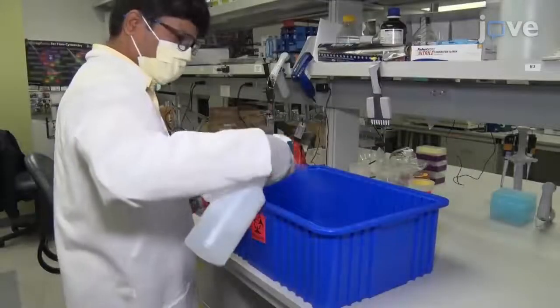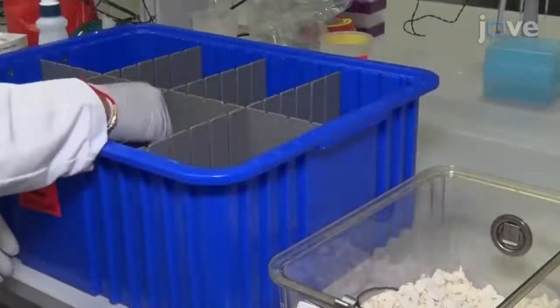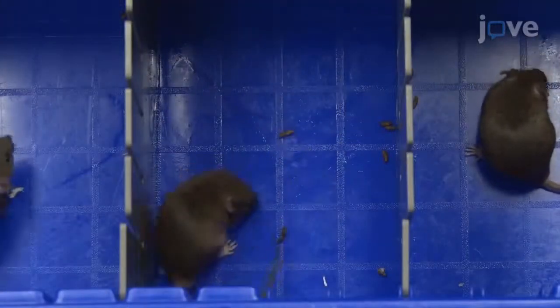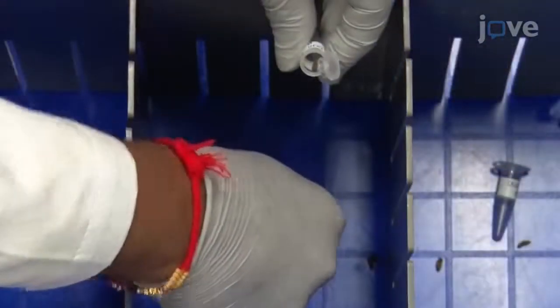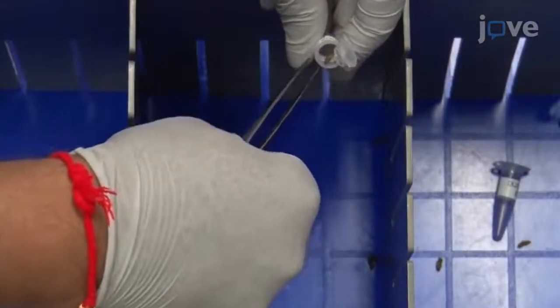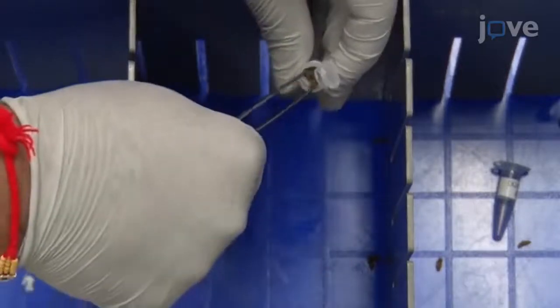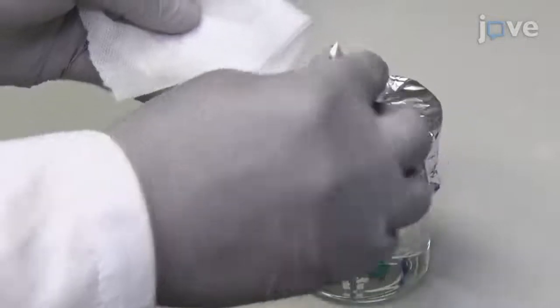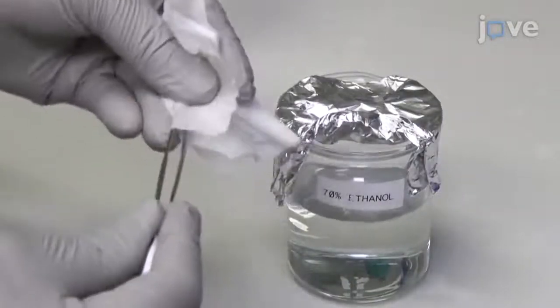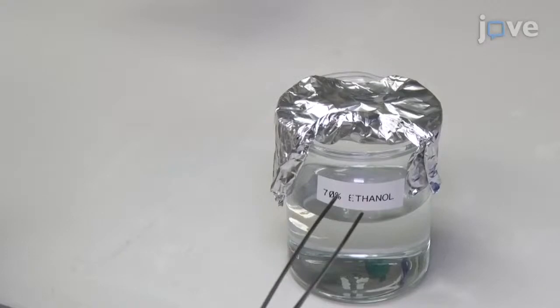To begin, sterilize the divider boxes with 70% ethanol. Place the mice in sterilized divider boxes and allow them to defecate normally for up to one hour. Use sterile forceps to collect the fecal pellets in an empty pre-labeled 1.5 milliliter microcentrifuge tube and close the tube securely. Sterilize the forceps with 70% ethanol followed by a germicidal disposable wipe after collecting fecal from each mouse.